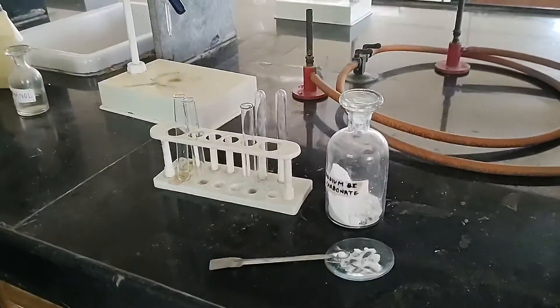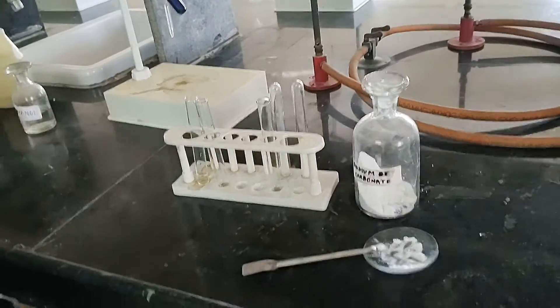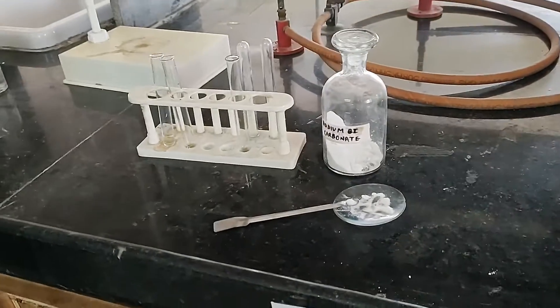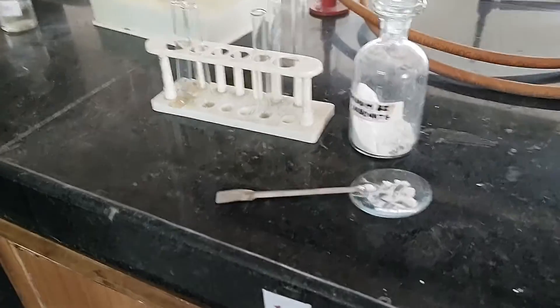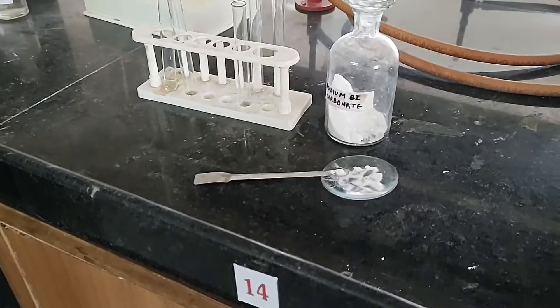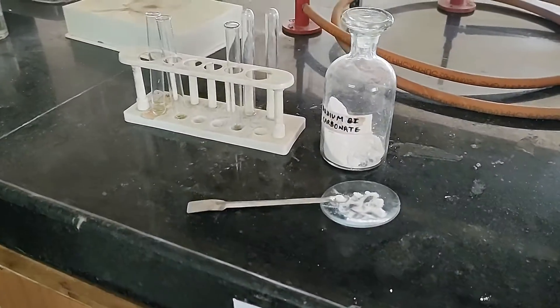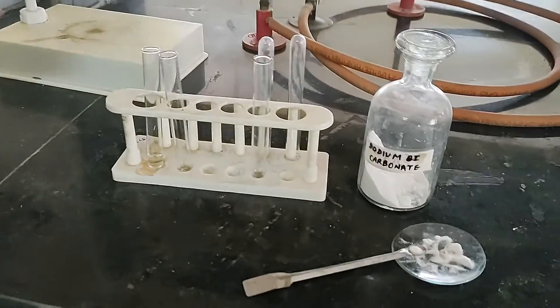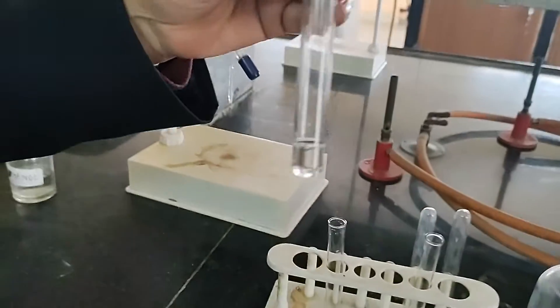Good morning students. Welcome to your chemistry lab. Today we are performing the functional group test in organic compounds. Today I will perform the test for the functional group that is the carboxylic group present in an organic compound. Let's see this.